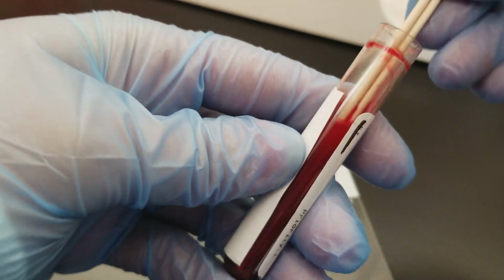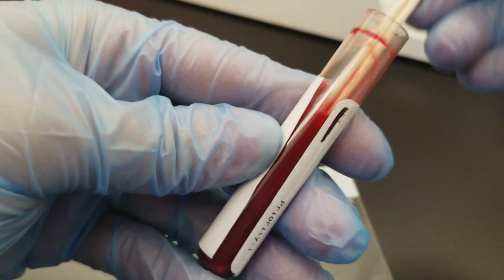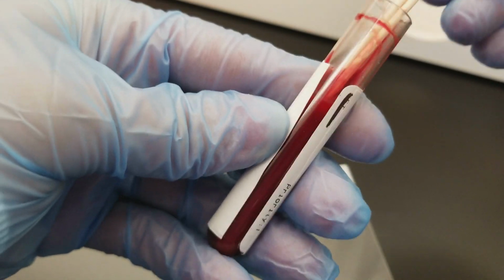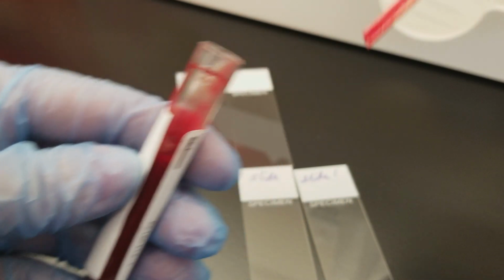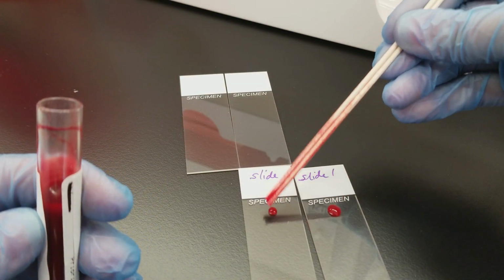This one does not look clotted, so that's good. All right, it's a nice bright red. It means it's fresh. It could or it could not be. It all depends on the date, obviously. Okay, so then what we're going to do now is put a drop on there.